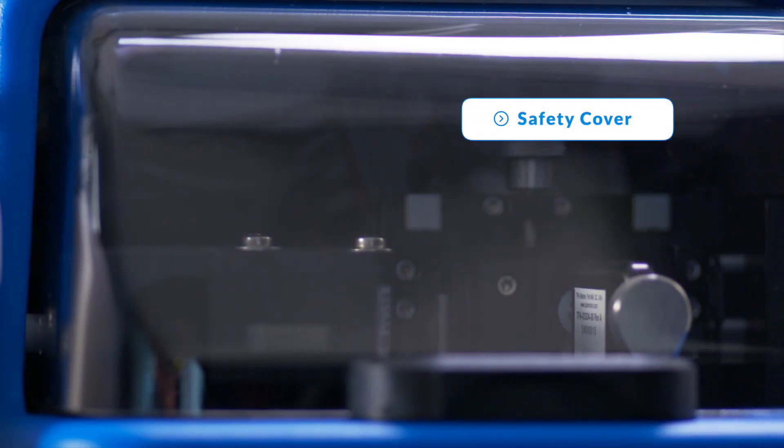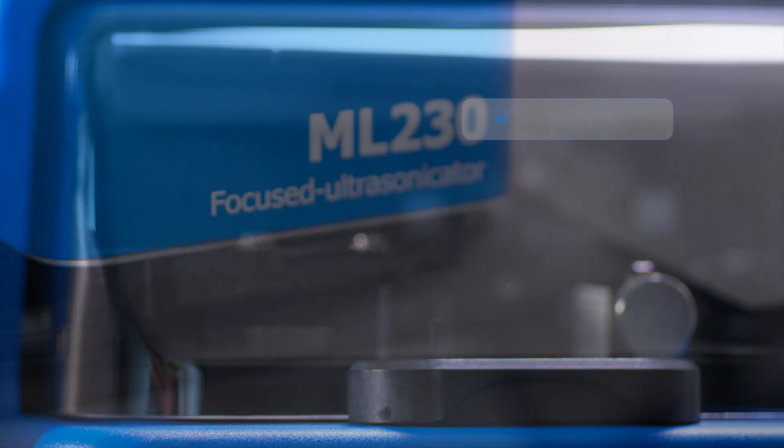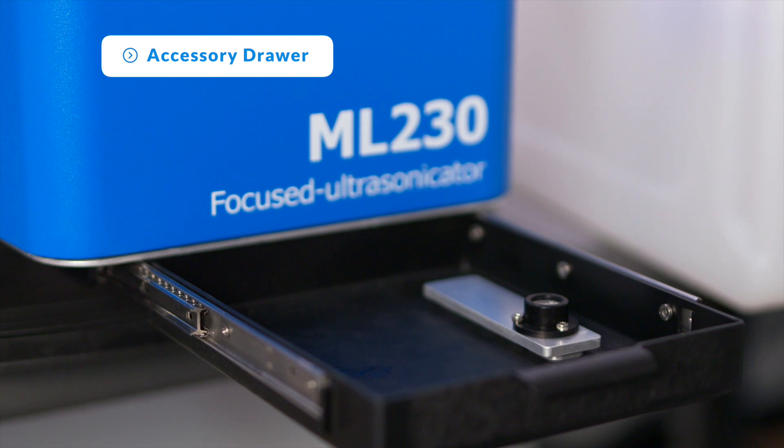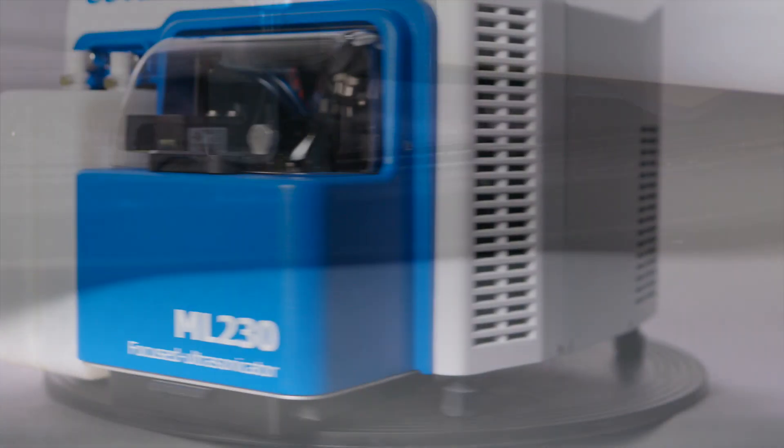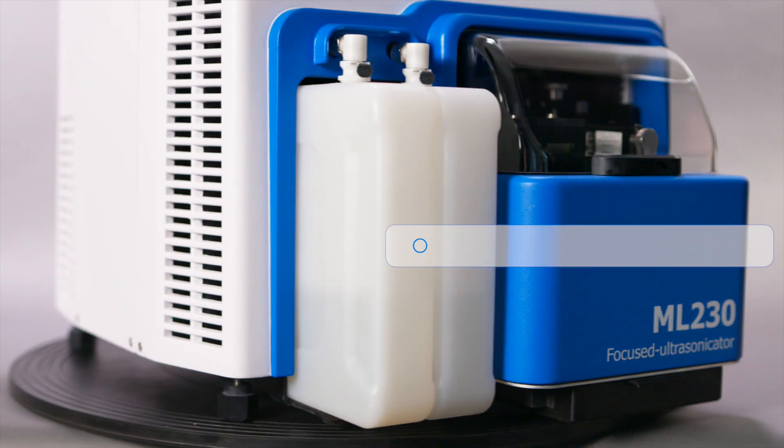A safety cover to fully enclose and protect the sample handling system, an accessory drawer for quick access and organized storage of tools and accessories, leveling feet to keep the system level on the benchtop with ease, and an onboard automated reservoir and drain system for simplified maintenance.